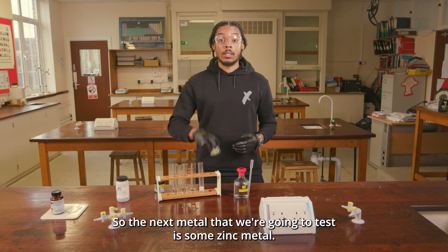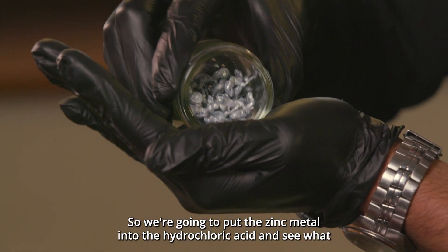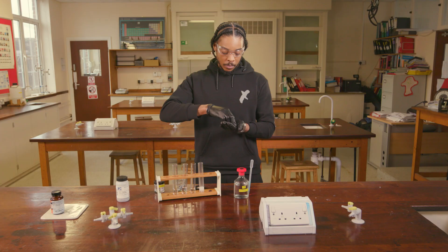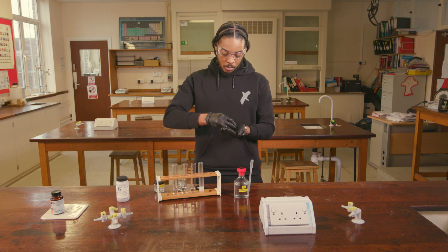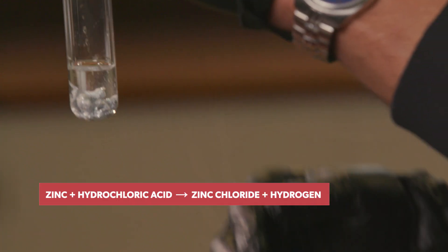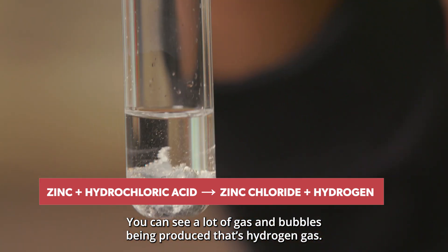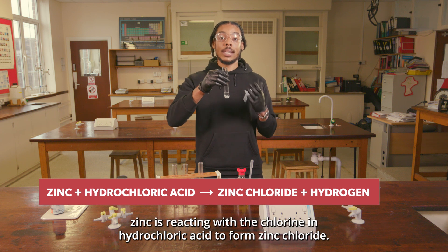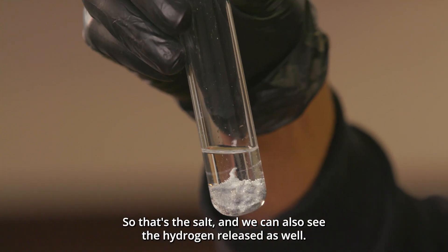The next metal we're going to test is zinc. We're going to put the zinc metal into the hydrochloric acid and see what reaction occurs. As soon as I put the zinc in, we can see a lot of gas and bubbles being produced — that's hydrogen gas. The scientific term for bubbling and fizzing is effervescence. The zinc is reacting with the chlorine in hydrochloric acid to form zinc chloride, which is the salt, and we can also see the hydrogen being released.